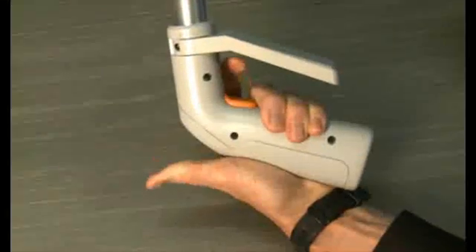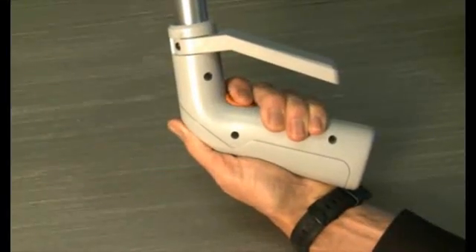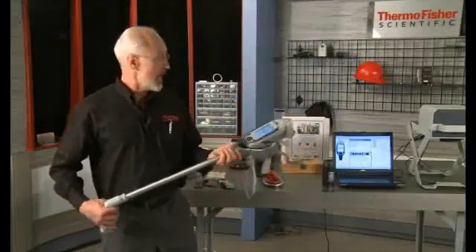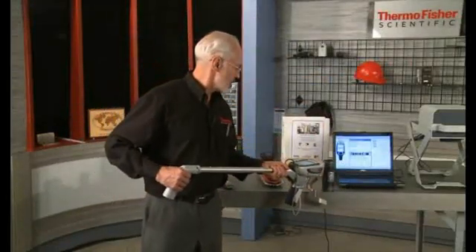You can operate your Niton XL3 through the trigger of the Extendipole as if it were the trigger of the Niton XL3. Using the Extendipole, you can test samples distant from a catwalk, high off the ground over your head, and in difficult-to-reach areas.